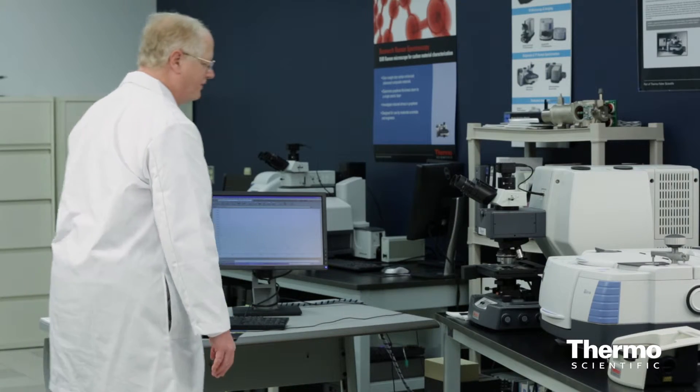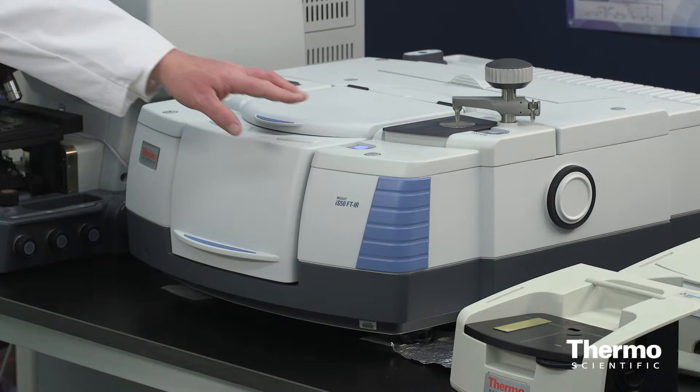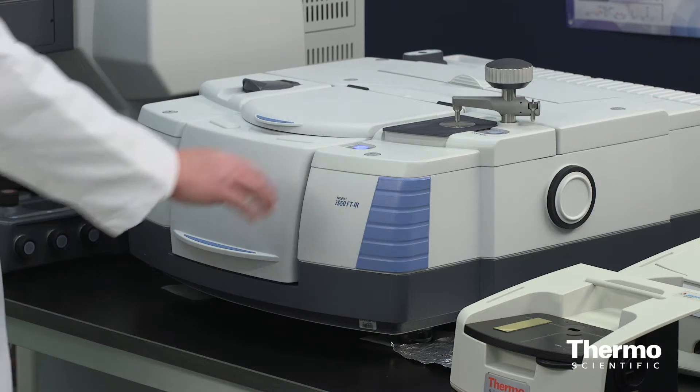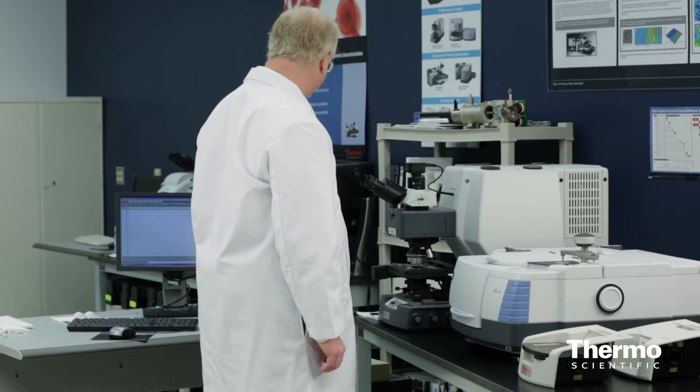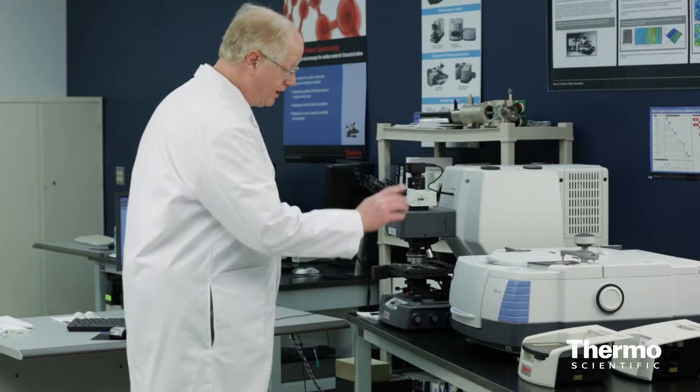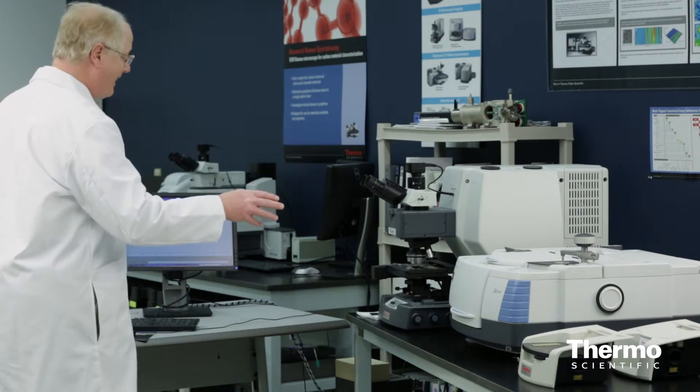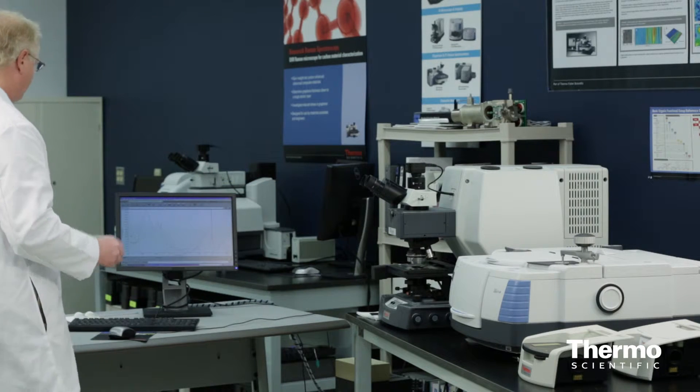I'm going to show one quick feature of the Nicolet IS-50: the touch button right on the front. I can actually start the data collection using this touch point, which begins the collection on the instrument. I can also stop it or do an analysis if I connect the control to that button.